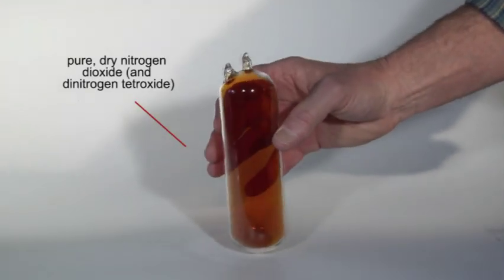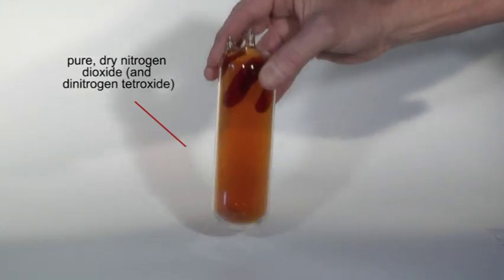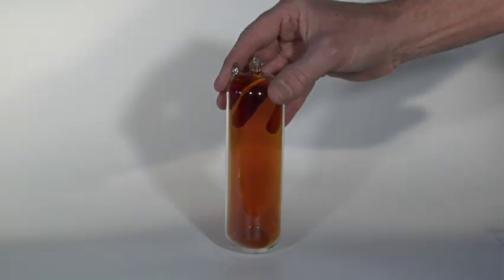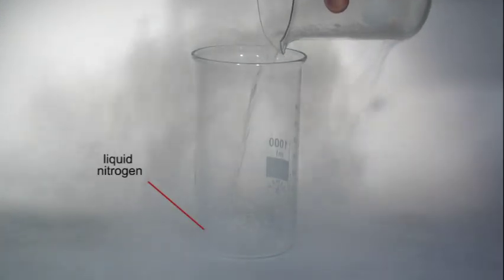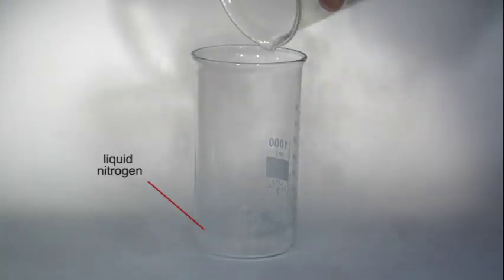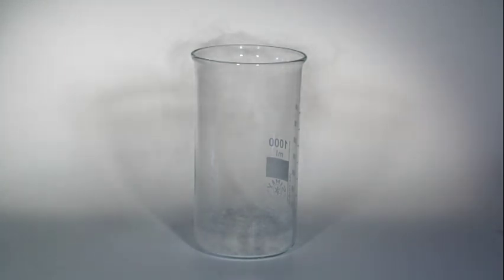Nitrogen dioxide is brown and produces the color of the mixture of the two gases present in this equilibrium. Liquid nitrogen is used to cool the mixture down to temperatures approaching minus 200 degrees Celsius.